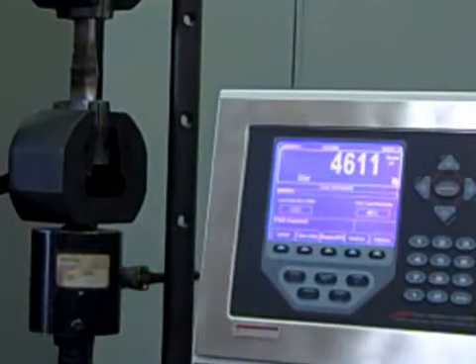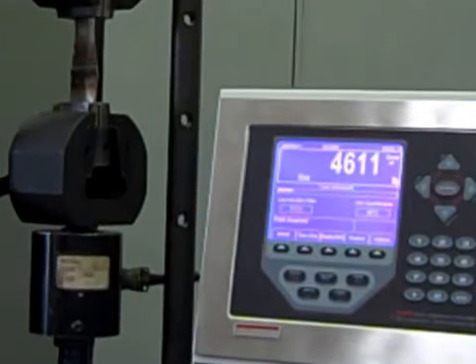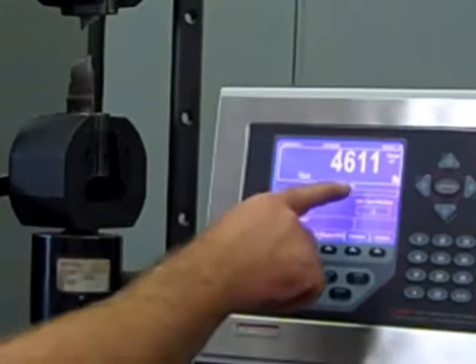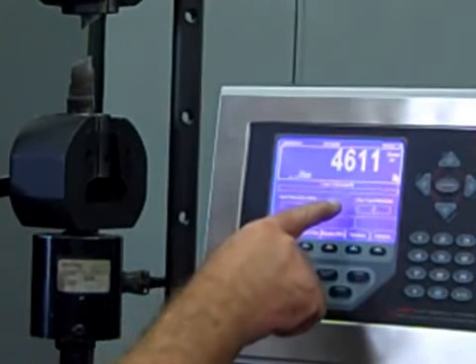The peak load is obtained, and the sample fails. The machine automatically records the peak load.